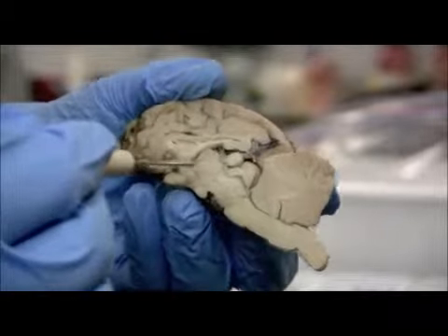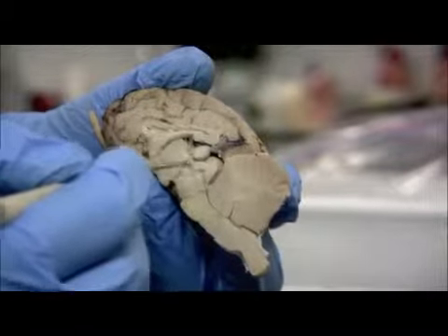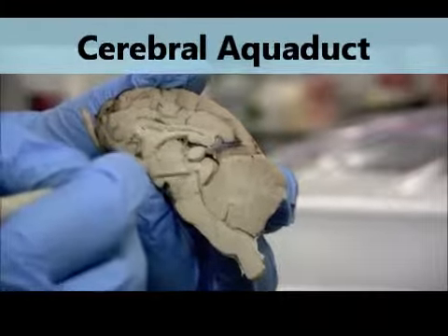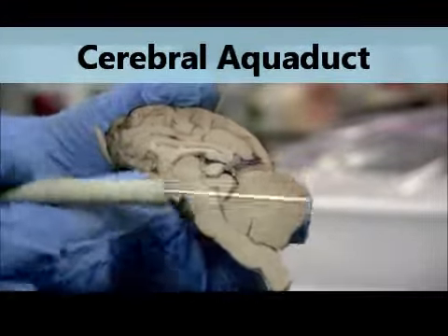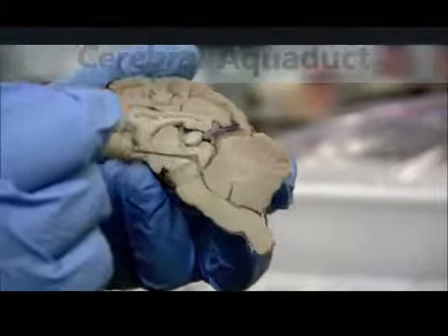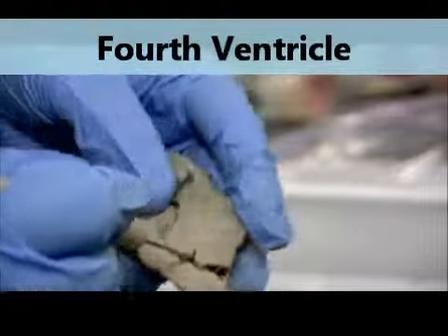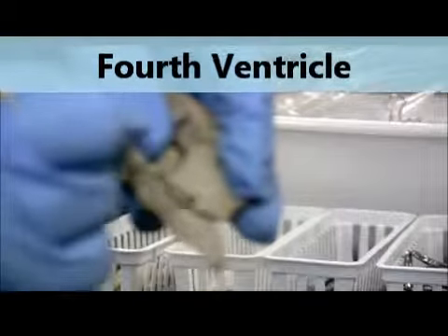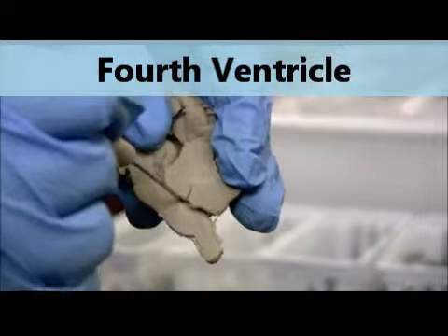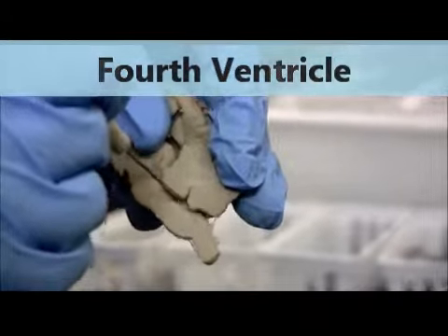The aqueduct of the midbrain that connects the third ventricle with the fourth ventricle is going to come down around the thalamus. It's going to be this connection right here that you can follow down. As we come down, it's going to go in between the rest of this brainstem and the cerebellum. So the aqueduct of the midbrain is this canal, and it's going to empty into this fourth ventricle, which is right here in this indent of the cerebellum. So it's right in the middle of the cerebellum that it indents, and the emptying of that canal is a more wide open space. That's the fourth ventricle.